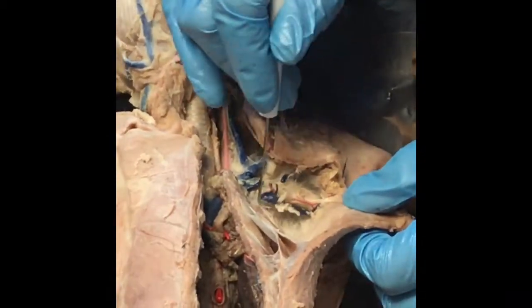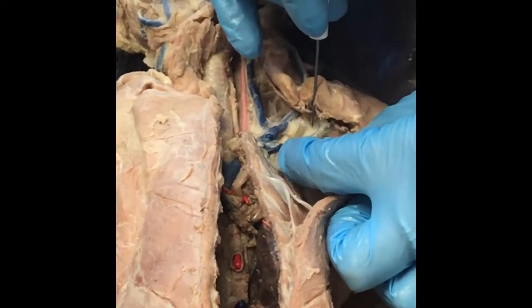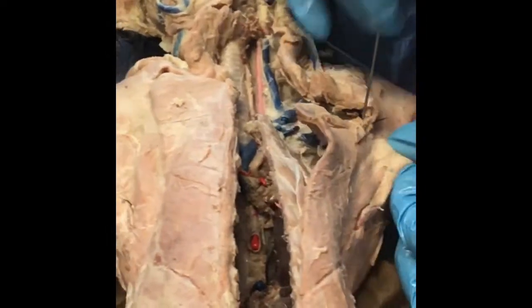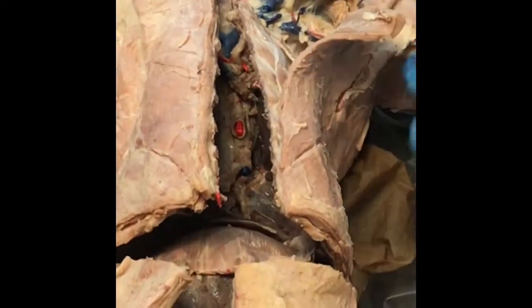Going out further, do you see how this kind of tore away there, and there's one that goes up? After that, that's going to be the axillary, and then as it comes out here, again, I will have to tear a lot of it off, but if it comes out here to the arm, that's going to be the brachial, and that's all veins.